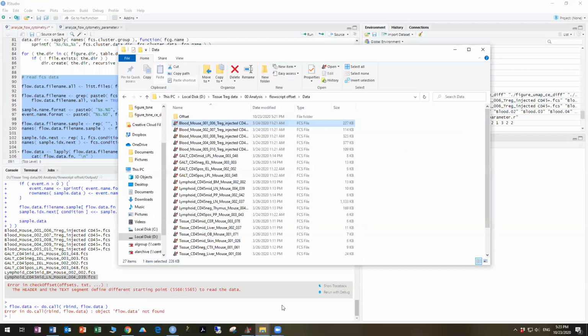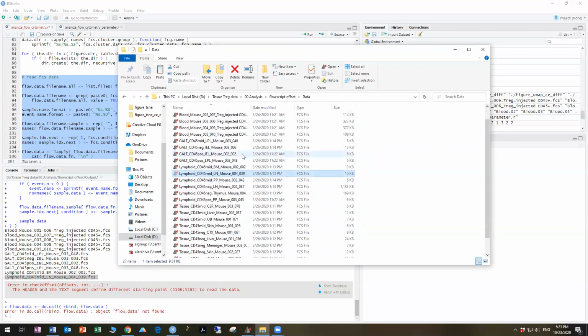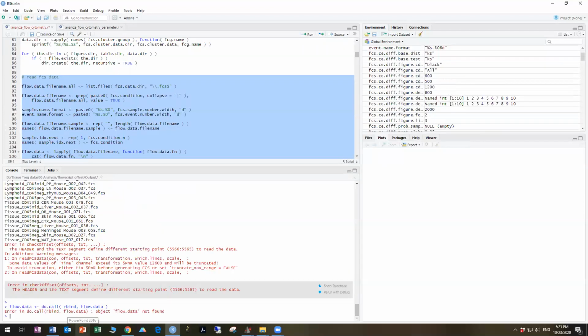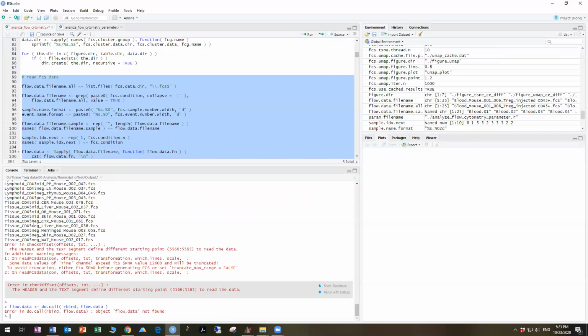So if we go in here and we go down to our lymphoid and we look for the one that says CD45 mid lymph node mouse 004039, we can just remove that by cutting and pasting it in here. And we'll run the command again. And we'll find out if there's any more offset errors. So you can see it got further down the list this time, and now it got to this file.